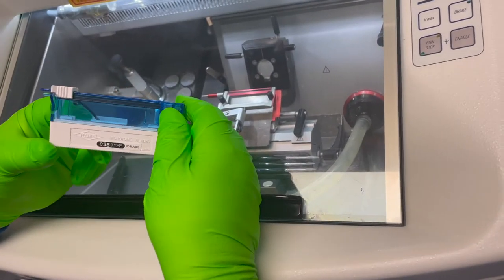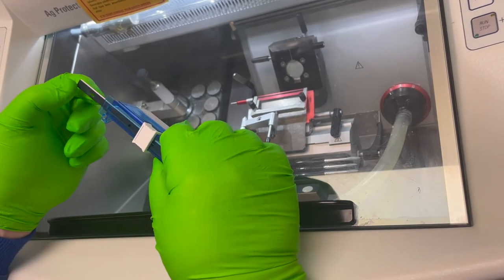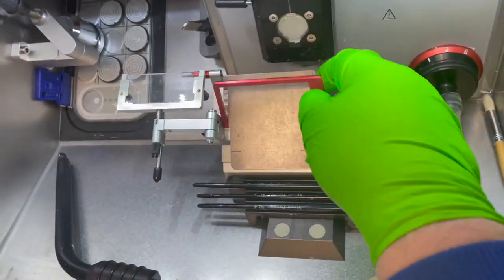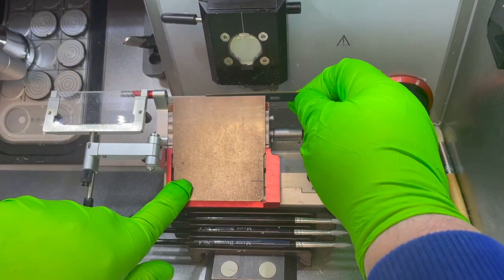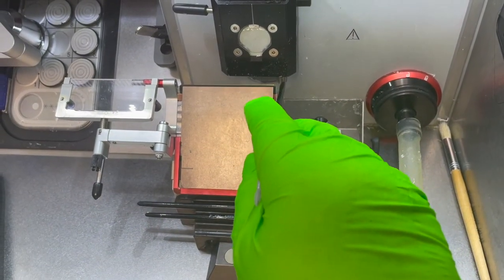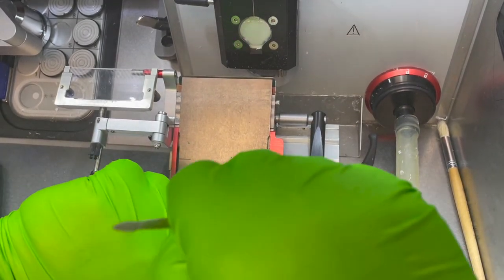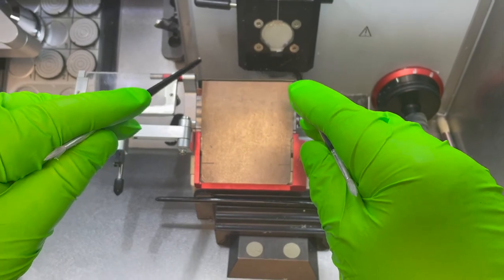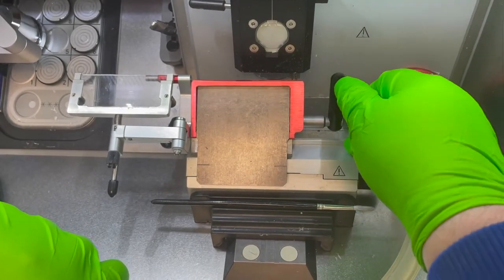So these are the C35 type blades — there are 20 in a pack. I'm going to eject one and insert it into the cryostat. If I put my finger on the diagonally opposite corner, it opens the jaw of that vise just a little bit, which makes it easy. Finish it off with a paintbrush. If it comes up on one corner, use another paintbrush to make certain it's at the same height. Don't touch the cutting edge — you'll damage it, even with a paintbrush. Then clamp it up.